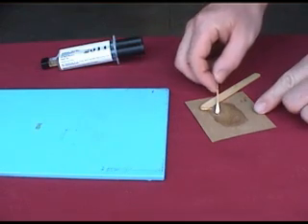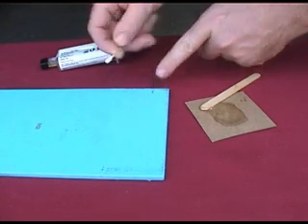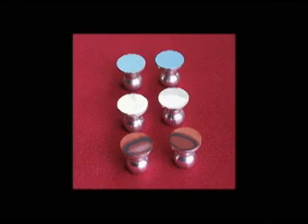Warning: with any adhesive selection, it is important to test and ensure that the adhesive does not react to the coating, resulting in a change in its cohesion properties or bond strength. The goal of any adhesion test is to determine the pressure at which an adhesive between layers or cohesive within a layer failure occurs.